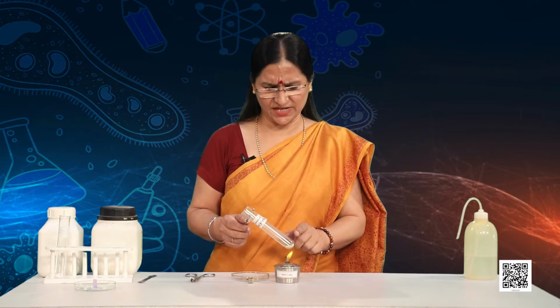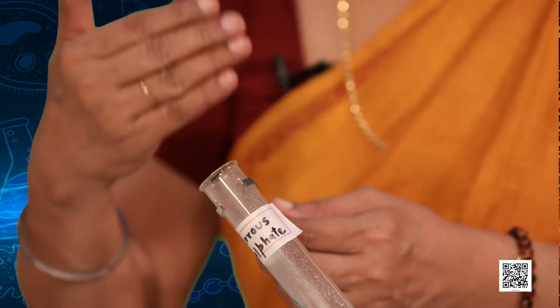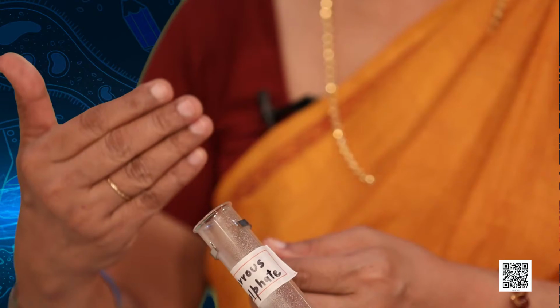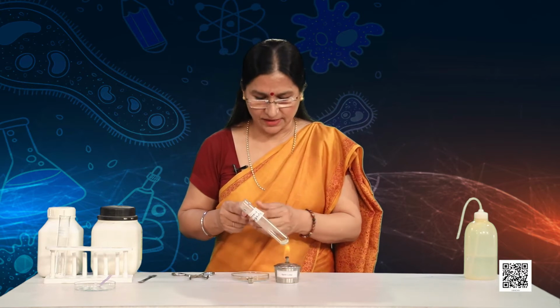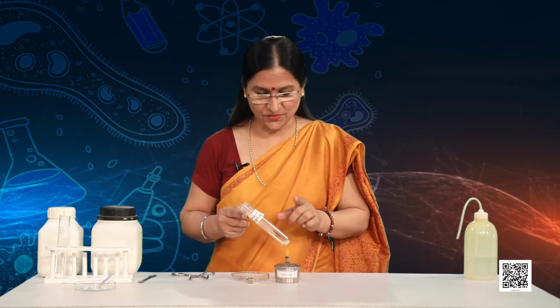Can you note the change in the color of the ferrous sulfate crystals? I think the green color has changed. And yes, the crystals are now turning brown. We can also smell a characteristic odor, and the correct way is wafting the gas gently towards the nose. Never inhale the gas directly. It may be harmful to you. And can you hear the crackling sound? Aha! The reactant ferrous sulfate is breaking down.